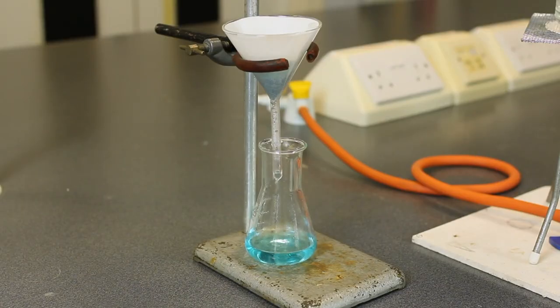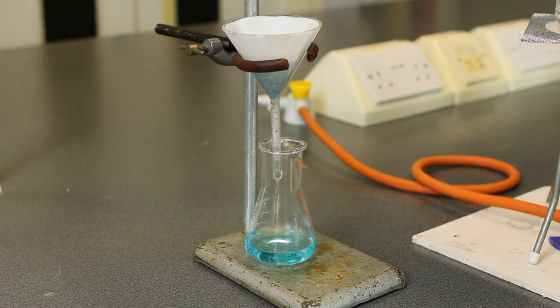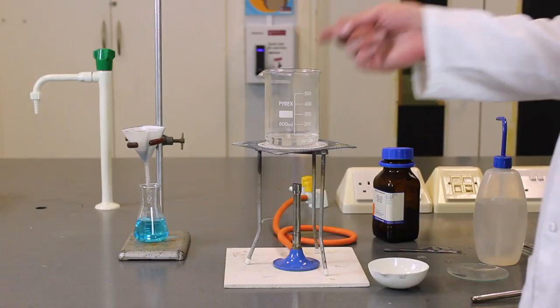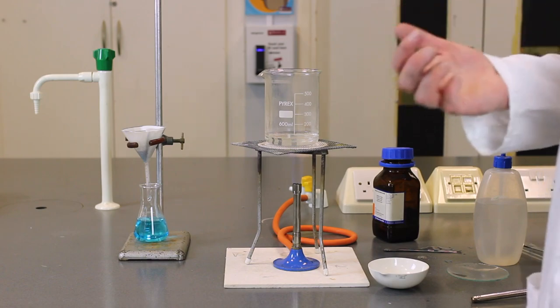And you can see a nice blue colour due to the presence of the copper sulphate that we formed in this neutralisation reaction. Okay, so now you can see that we've carried out the filtration and in the conical flask at the bottom there we got a blue solution which contains the copper sulphate and also some water.